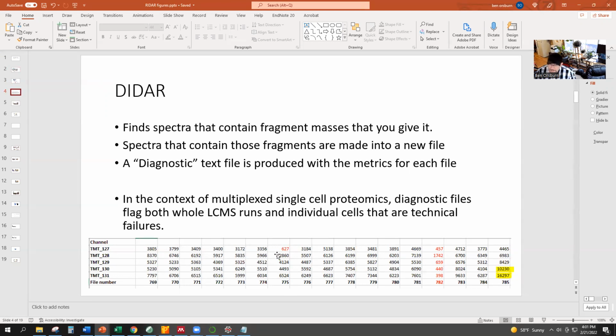Where all the rest of them, maybe the 128 wasn't too great either, but here we've got 6,000 spectra with reporter ions from 131, but only 600 from 127. So this is a flag for, hey, something went wrong with that cell. And in addition, we can flag entire runs where something went wrong. This entire LCMS injection 782, basically no reporter ions across the board from single cells, maybe something from a 128. And then here I've highlighted, you really can see the upper outliers too, and cells that went really well.